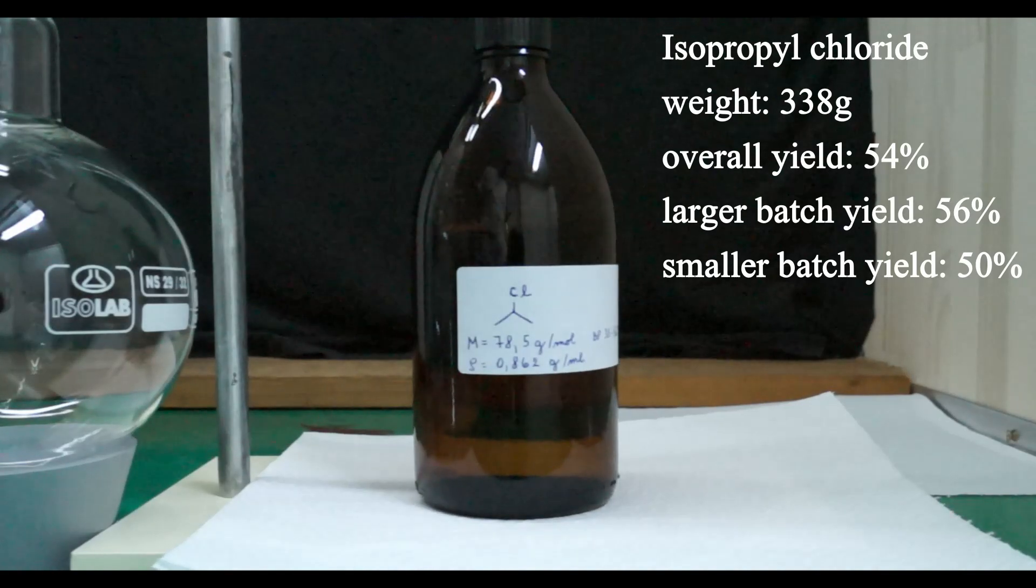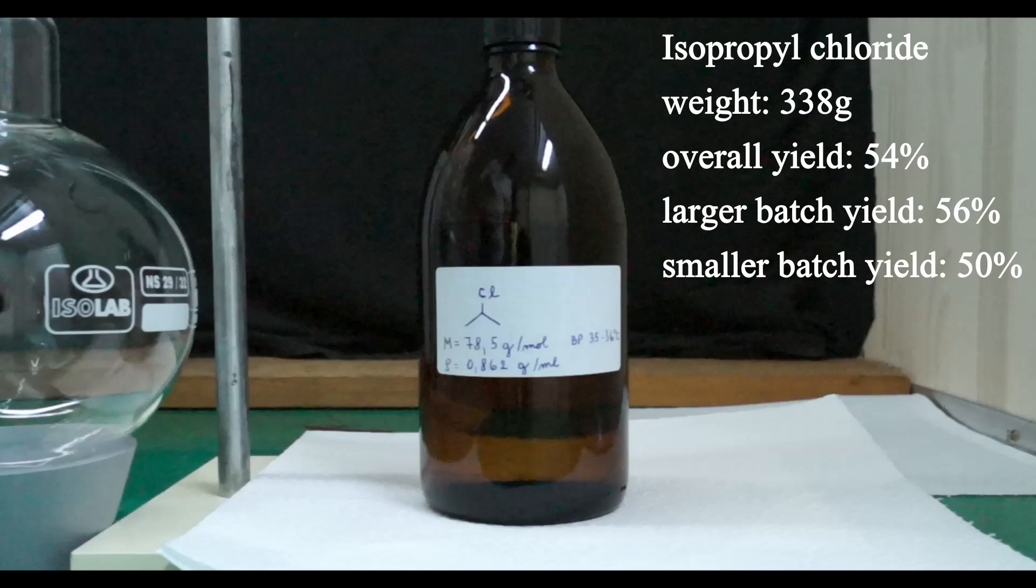The final major loss probably occurred as I was working up my crude product. The losses during the neutralization with sodium bicarbonate solution were likely especially high due to vigorous carbon dioxide evolution.